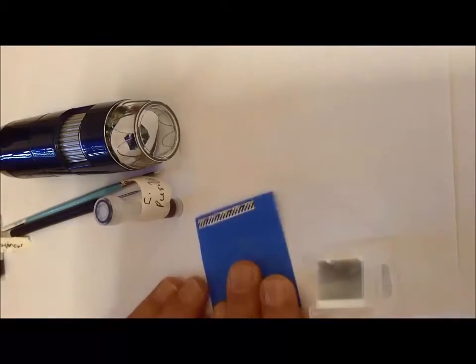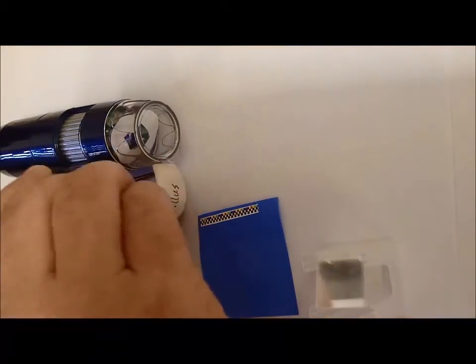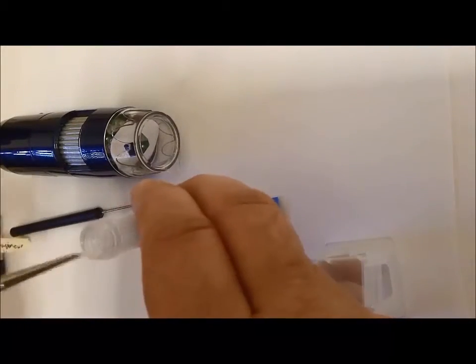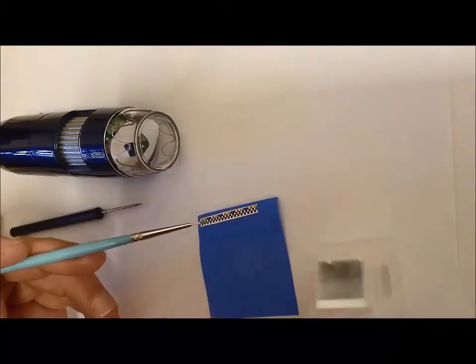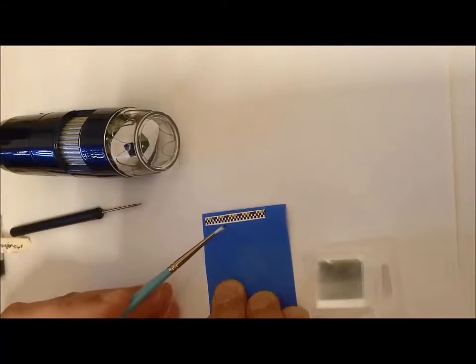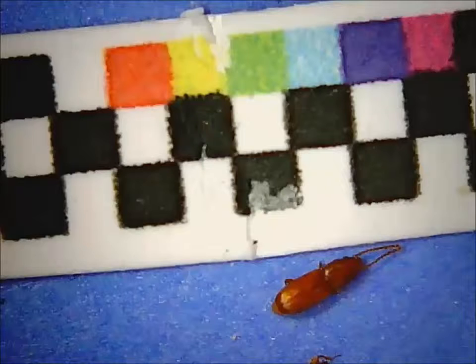So I'll take a specimen out and place it onto the sticky side of the post-it note next to the scale bar. And the post-it note stickiness lets you move the specimen around so that you can get it in the orientation that you want. So I'll put it back up, and looking under the microscope here on low power, I'll take an image of this and I will transfer that onto my PC.